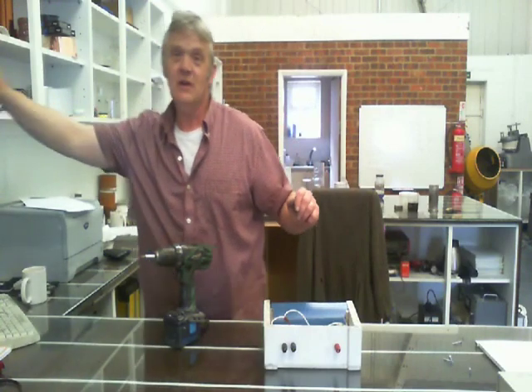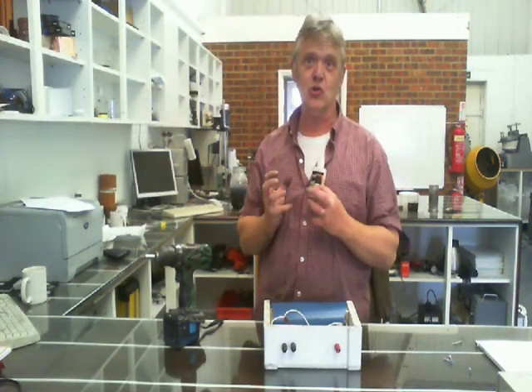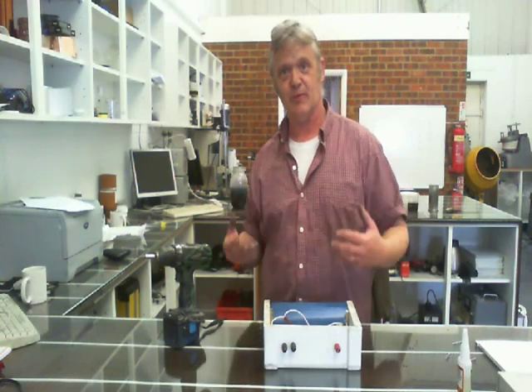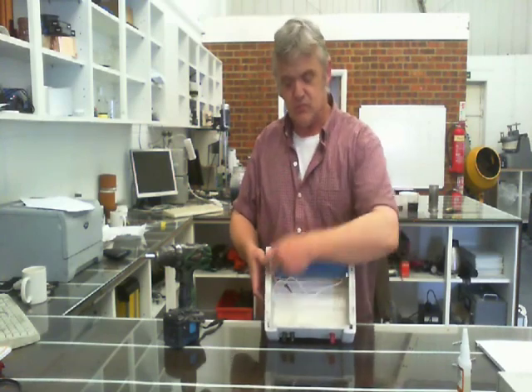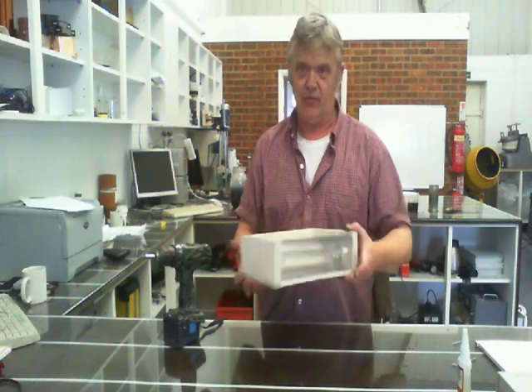And you glue it with this stuff, which is cyanoacrylic glue, and it glues so strongly that the glue bond is actually stronger than the material. And if you try to separate it, you in fact snap the material as opposed to snapping the glue bond. So it glues really easily as well. So all I did was cut out a couple of strips of the right width there to make the side, and a top piece that I cut out there.